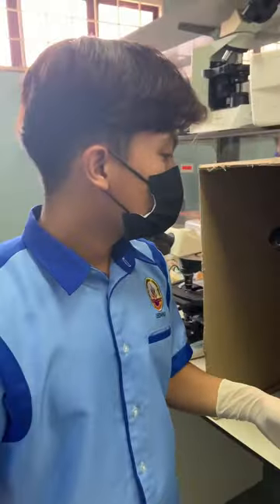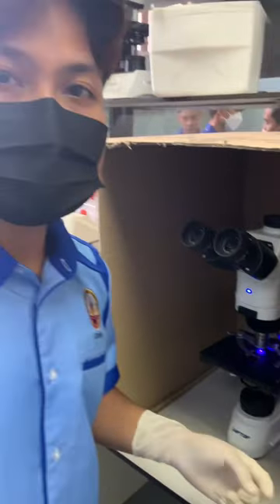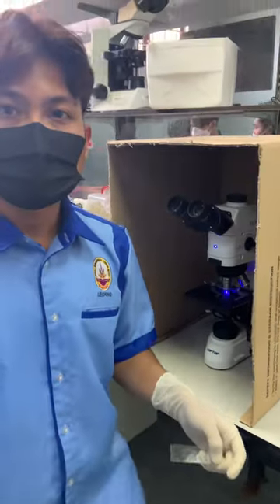After we're going through the microscope, the patient positive will be taken to the doctor to do the procedure.